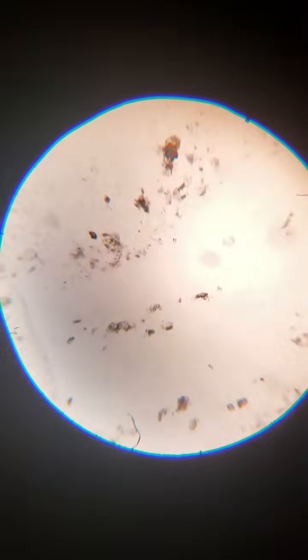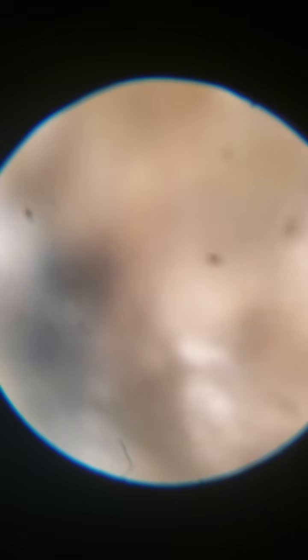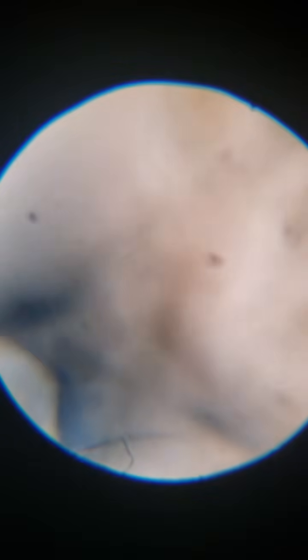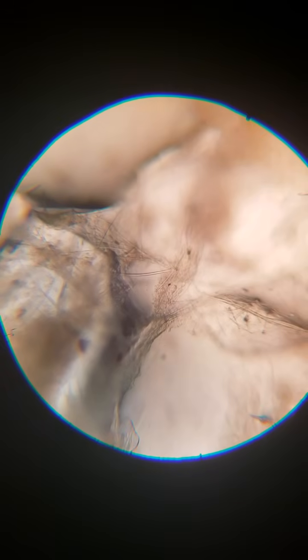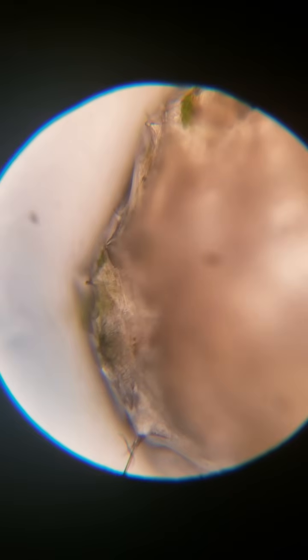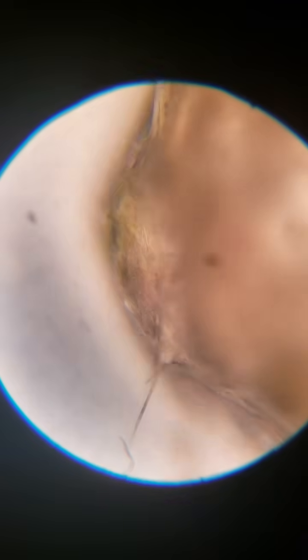And the sponge looks like this, just so you guys know one more time. Pretty different, huh? Very interesting life forms. I implore you to get empowered and go learn about them. There's the diatomaceous algae that they like to live with.